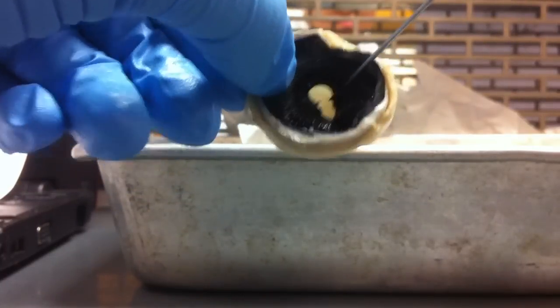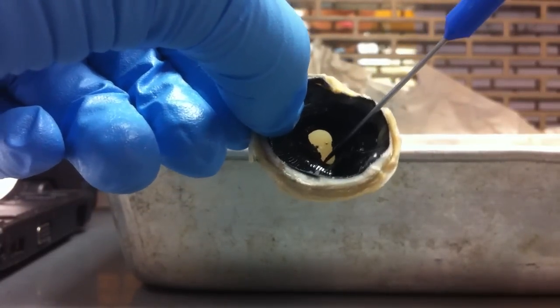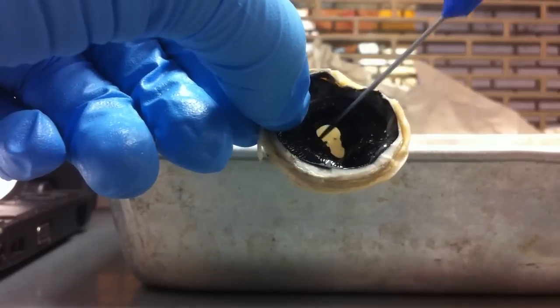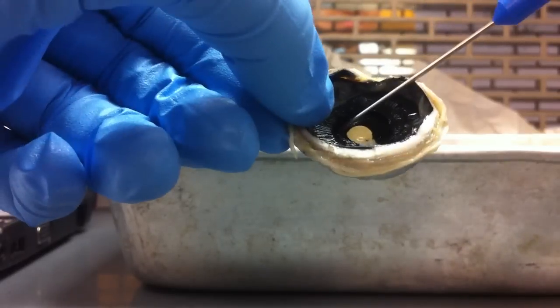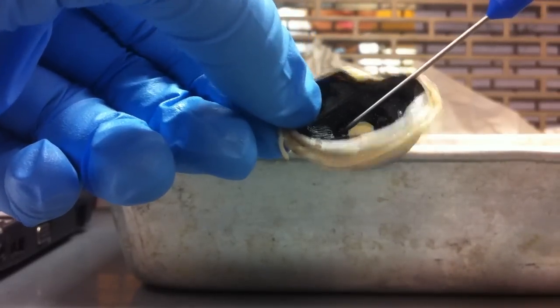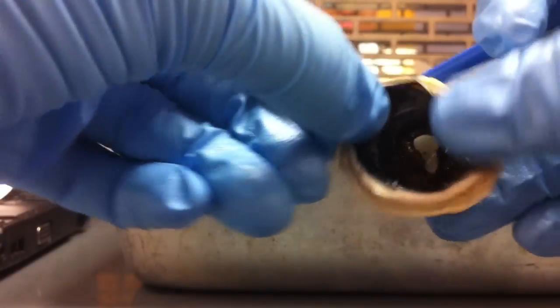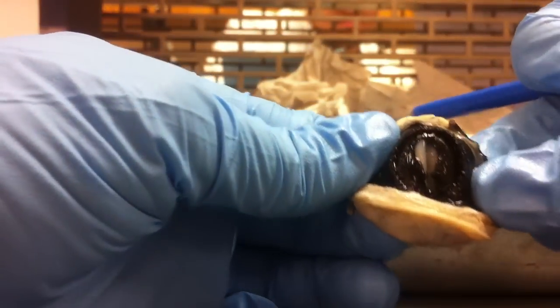And between your iris and your lens, which is this space right here—I'm not sure how well you can see it. Let me try to turn the eye inside out a little bit.